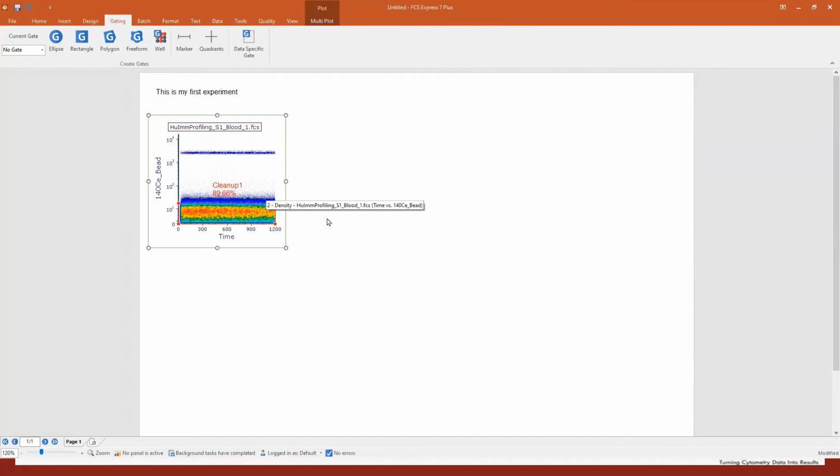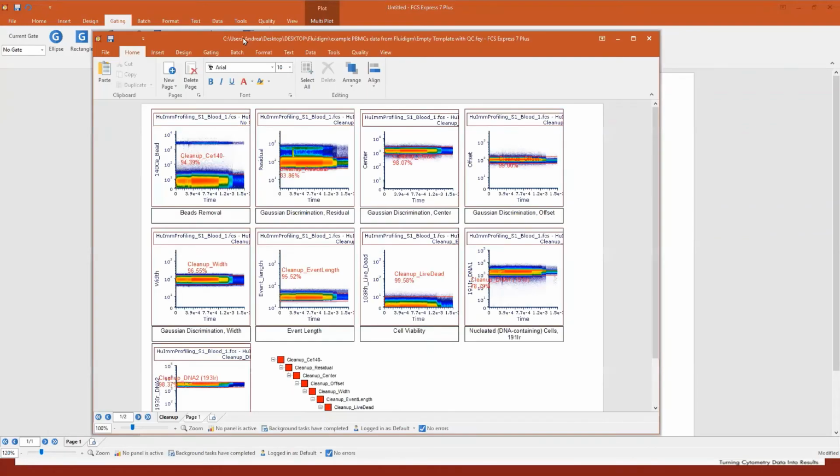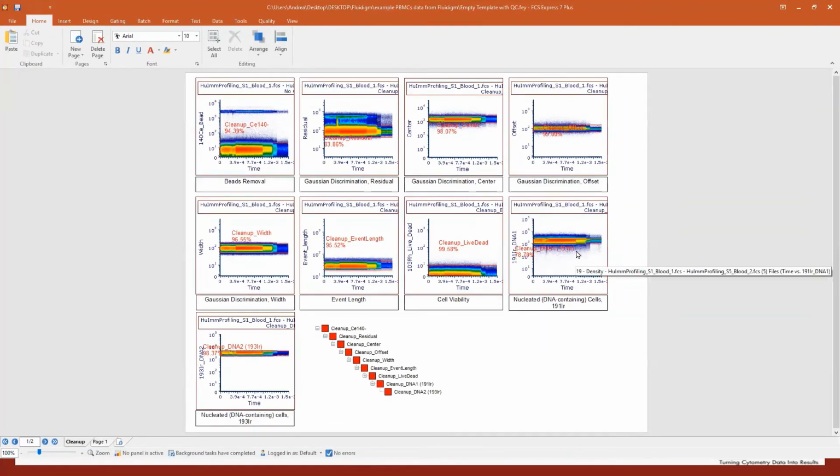Of course, if it happened that you have some fluidic interruption, then it's much better to use the rectangle and gate out that interruption. But otherwise, you see the marker, it's pretty useful. Okay, so I have a layout here already open. This is exactly the same cleanup strategy that we saw before.